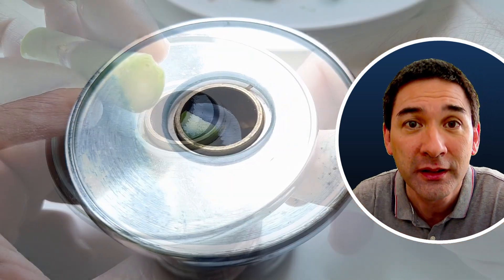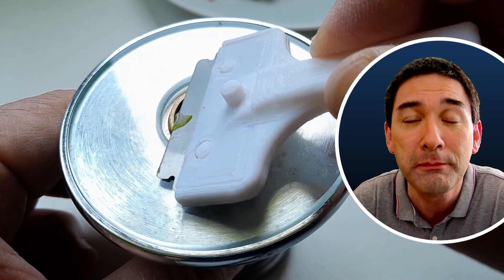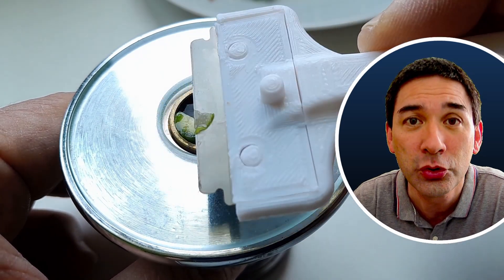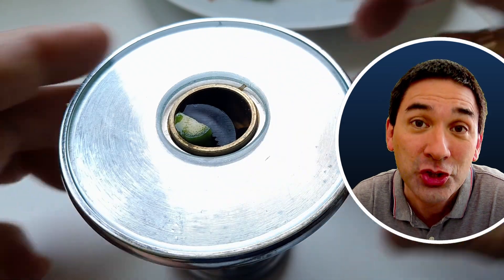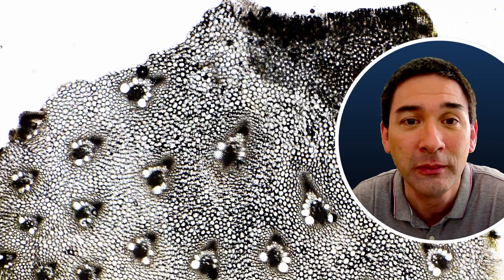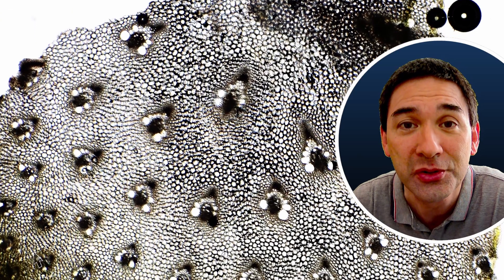Here I'm preparing it - it takes a little bit of time, so be patient. The more often you try to make a cut, the higher the chance that you're going to be successful. And then this is how it looks under the microscope.